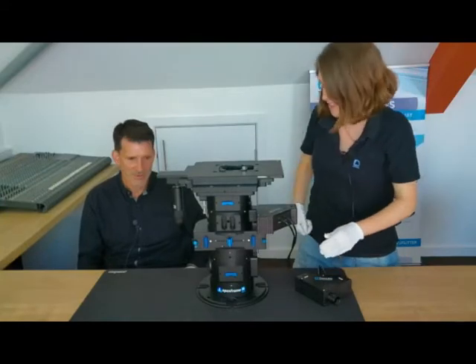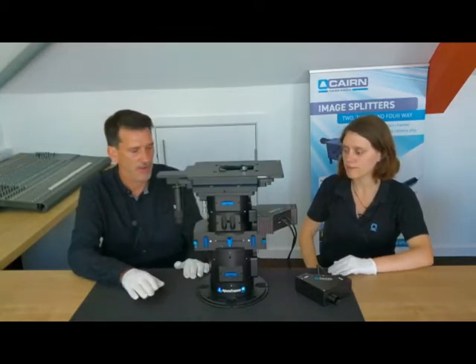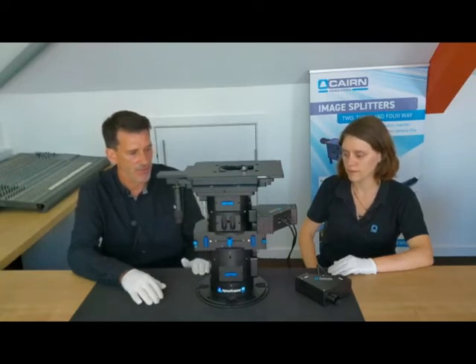Right, over to you, Jez. So just to summarise on the initial openFrame we've been showing things on, this is a fairly standard configuration, but even in this standard configuration we've got three different levels of access to the infinity space before the tube lens. In this kind of configuration, it will fill the field of view of a standard sCMOS sensor. For the very large sensors, it would be preferable to restrict it to two layers, as the field is dependent on the length of the infinity space. So this is a triple stacked layer.